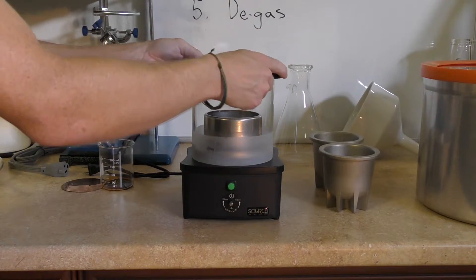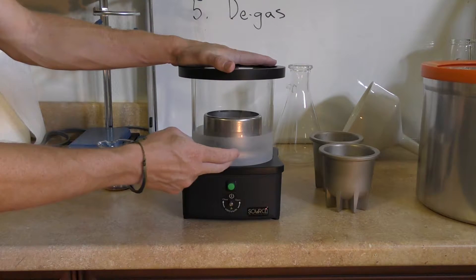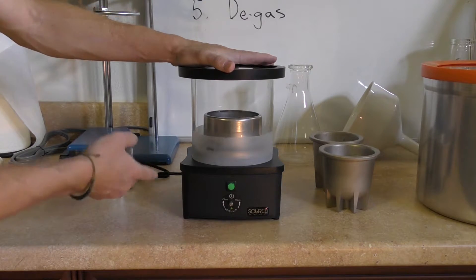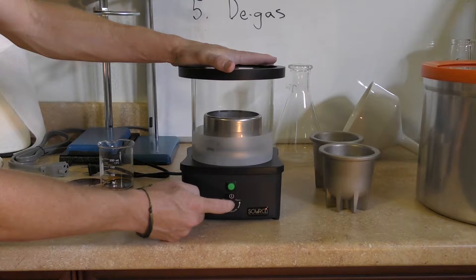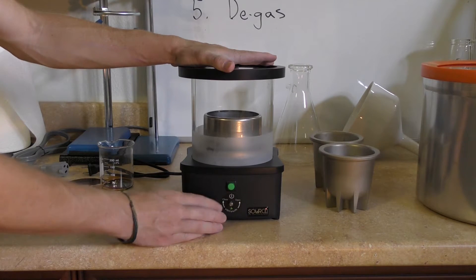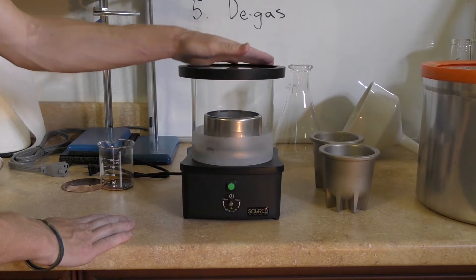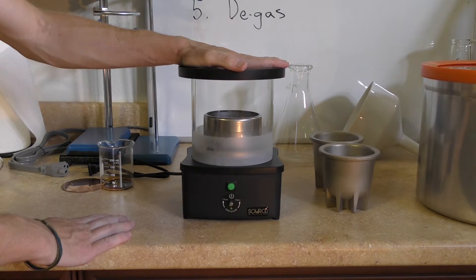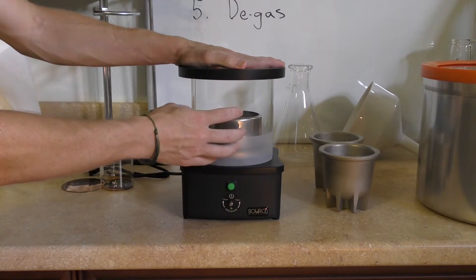When you're releasing the vacuum after the device is finished evaporating and the alcohol is condensed in the collector, you can just unplug it — though I'm not sure if that's the correct operating procedure — or you can release the vacuum by turning it counterclockwise. You want to listen for a hiss and the complete intake of air, telling you that the vacuum has been released. The second thing to be aware of is that it sometimes takes a bit of pressure on the lid in order for the seal to be created and for the device to hold vacuum.